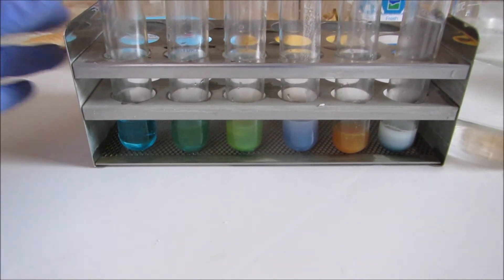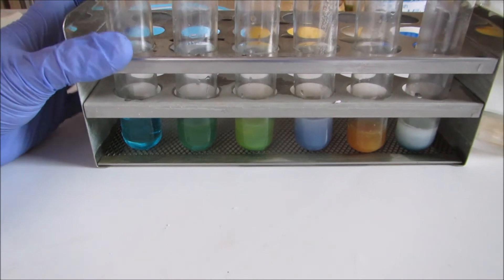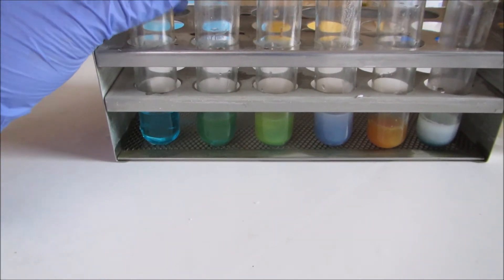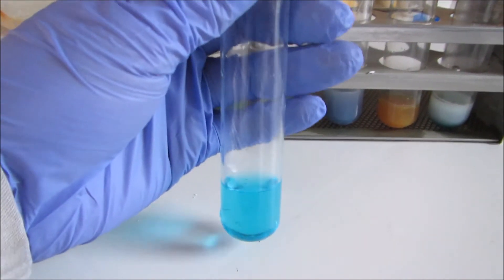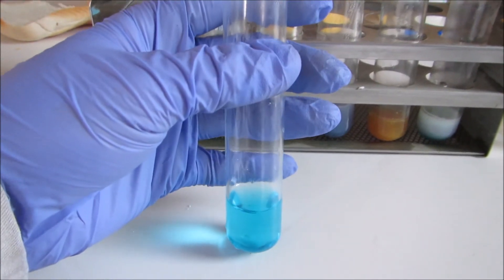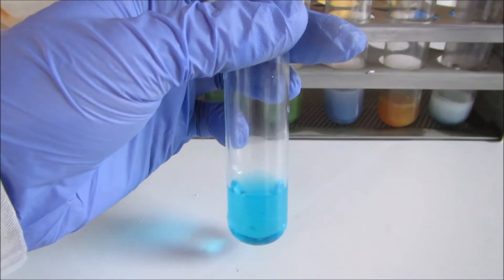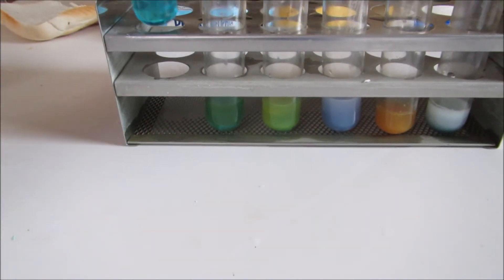Okay, so now the sugars test has taken place in the water. I can show you the results. The negative control, our deionized water, has remained the blue of the Benedict solution.